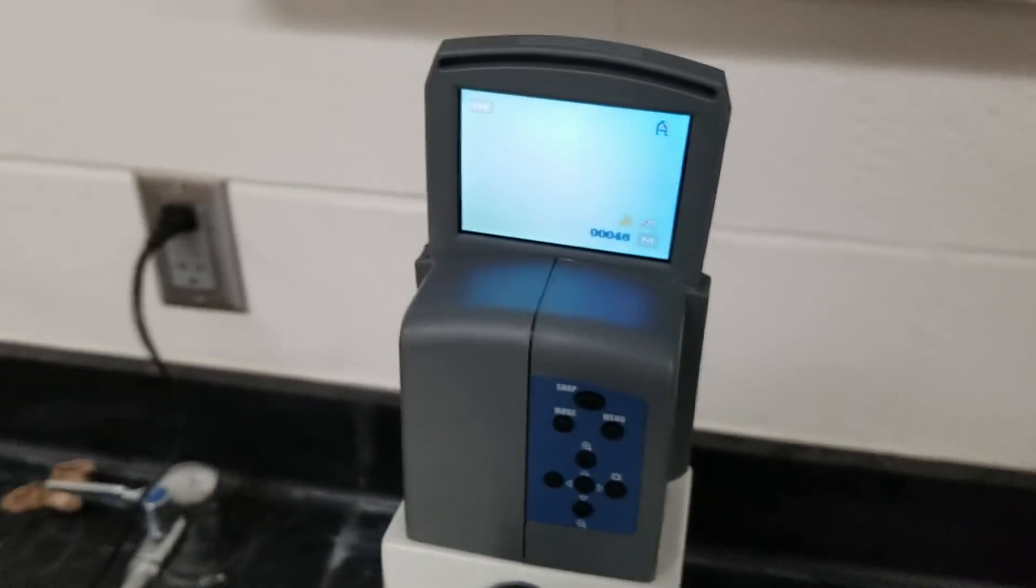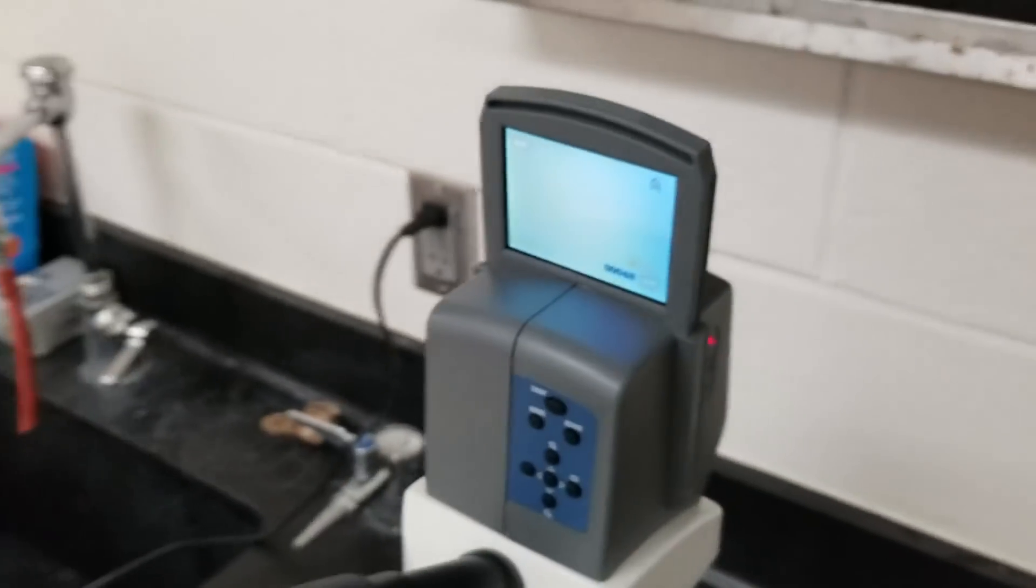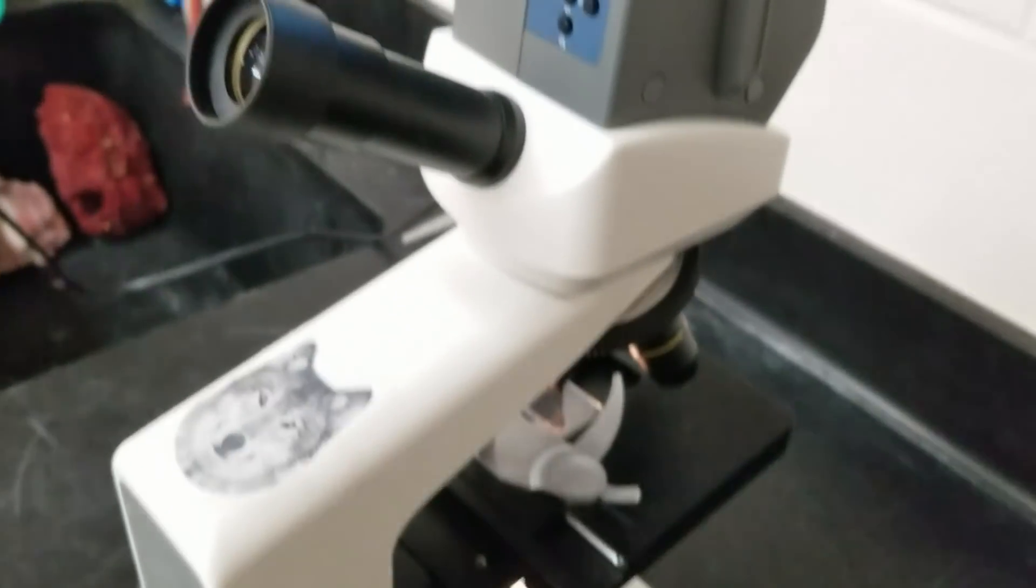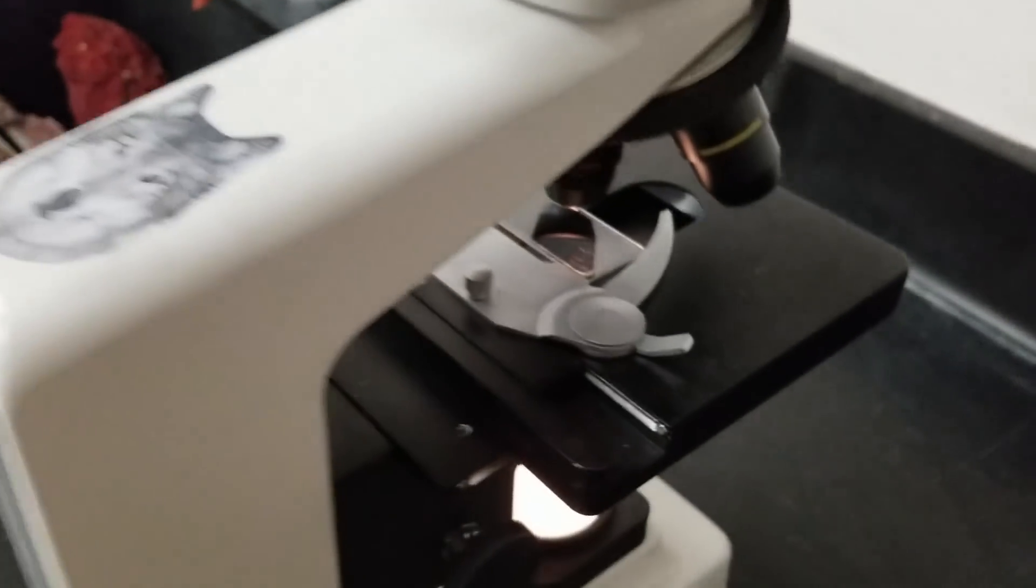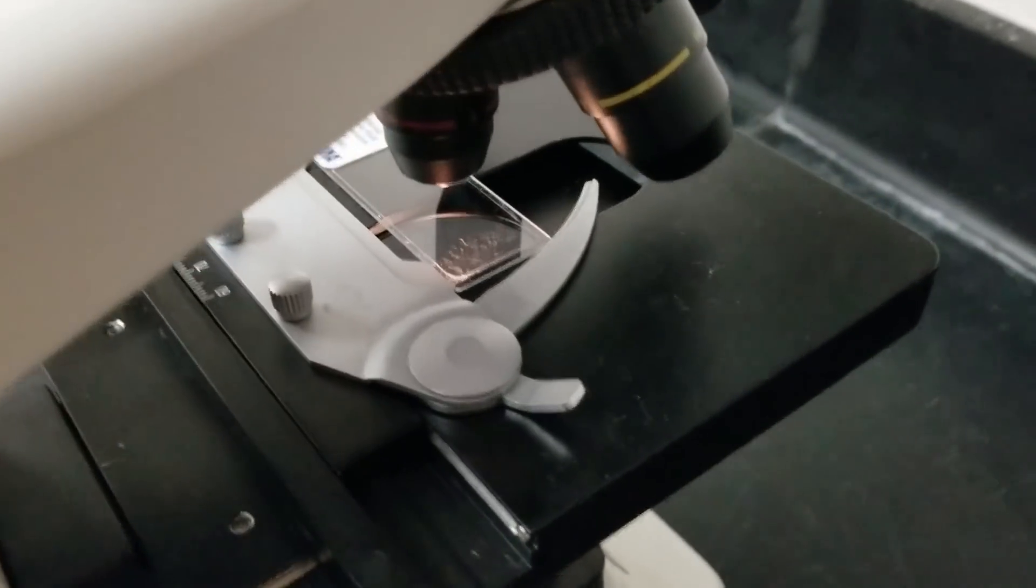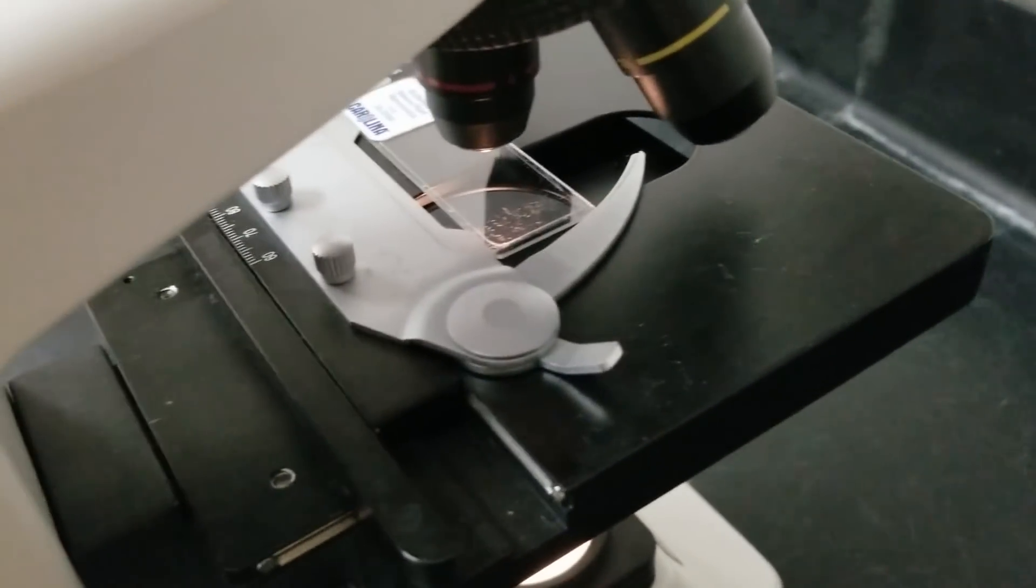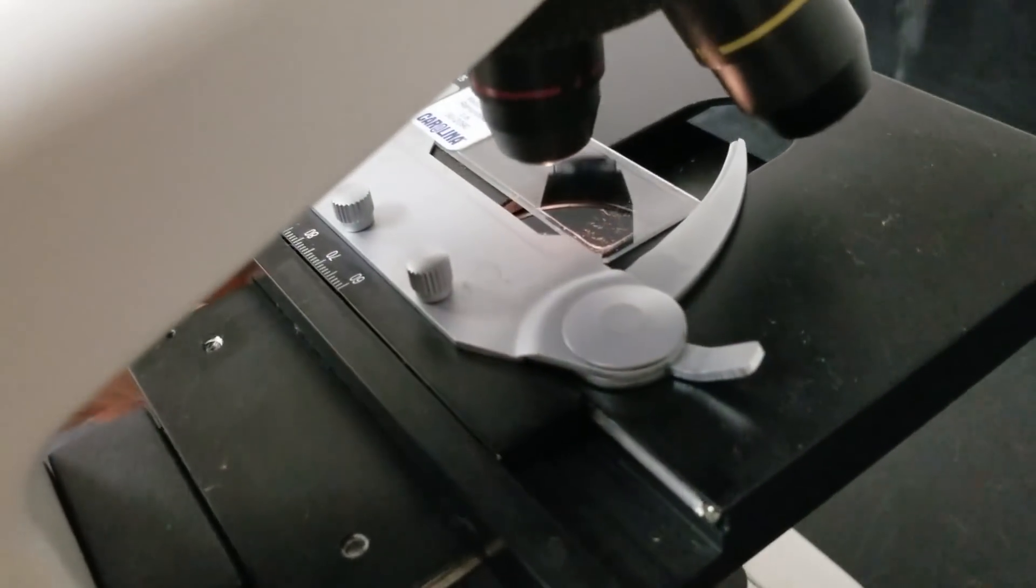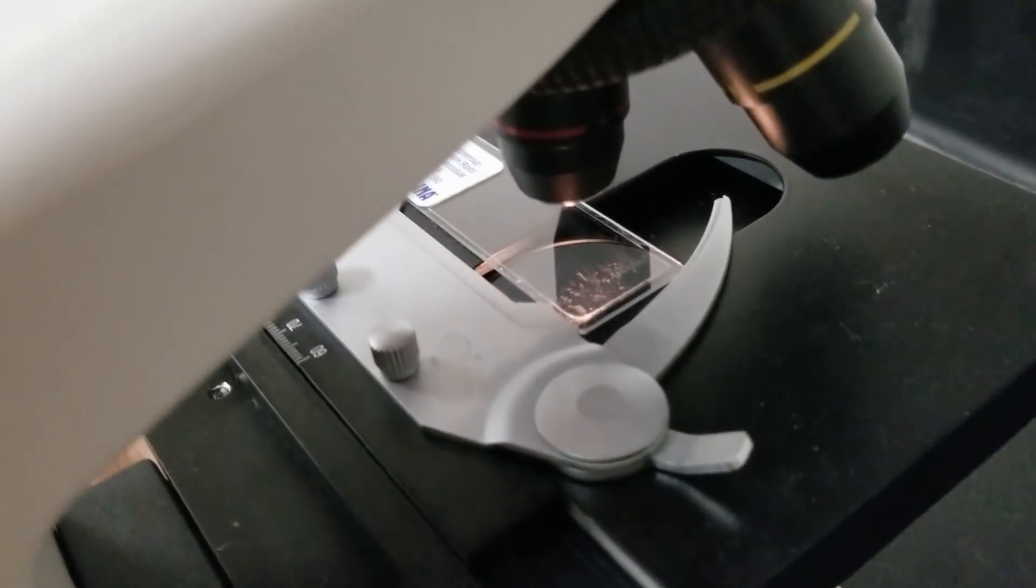Here's how we are going to adjust it because once you start adjusting it, it's very easy for it to get blurry again. First thing we're going to do is use our lateral adjustment knobs to get the center of the slide right in there in the light.